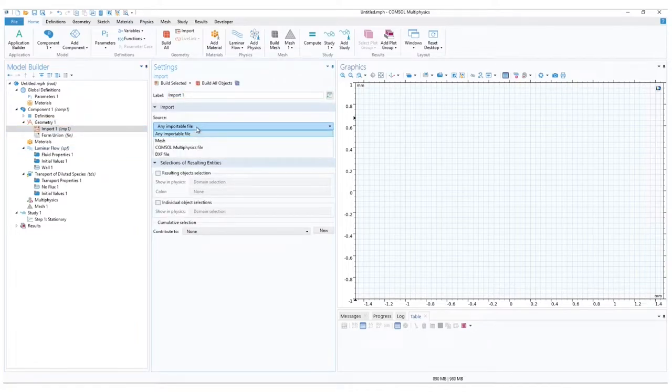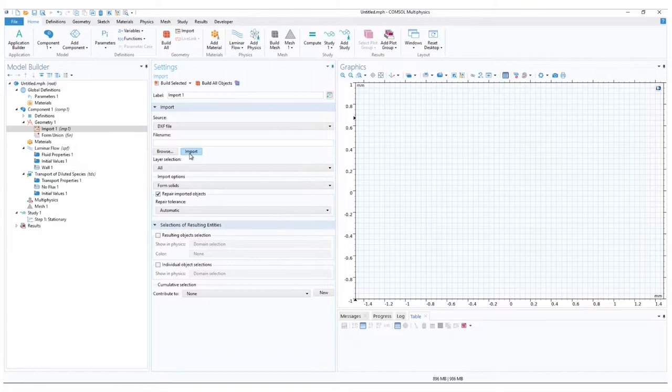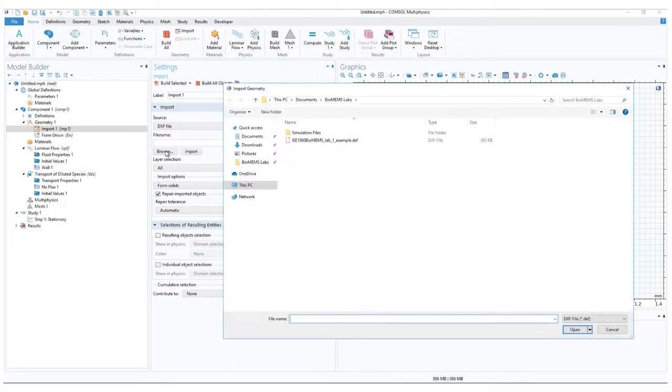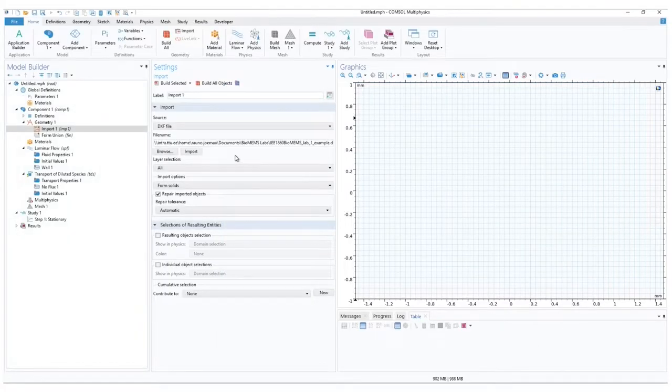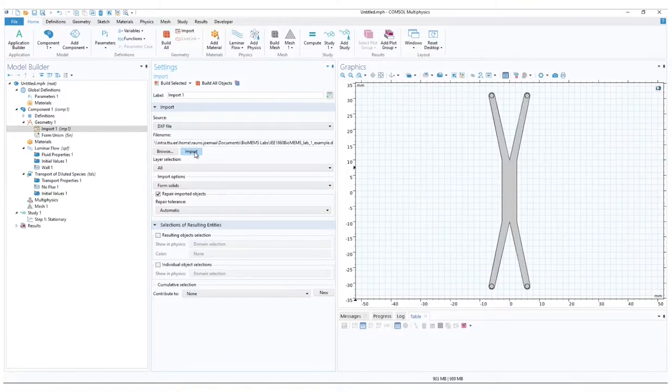For the source, select the DXF file and browse. Choose your DXF file and open. Without worrying about the other settings, click import and you will see a model appear in the graphics. Since the XY axis in our CAD program have been flipped, we have a vertical import. However, we can rotate it.